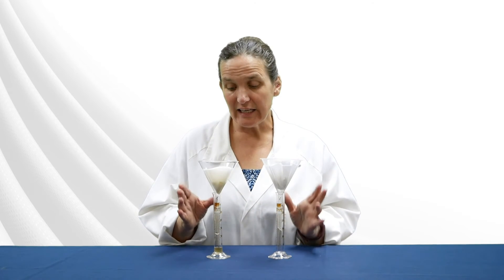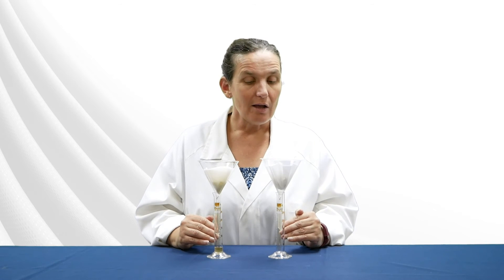We have demonstrated that the use of pectinase will increase the yield of juice from apples. Other variations on this experiment include comparing different varieties of apples, incubating samples at different temperatures or using different pH levels, or comparing cooked versus uncooked apples, or crushed versus uncrushed apples.